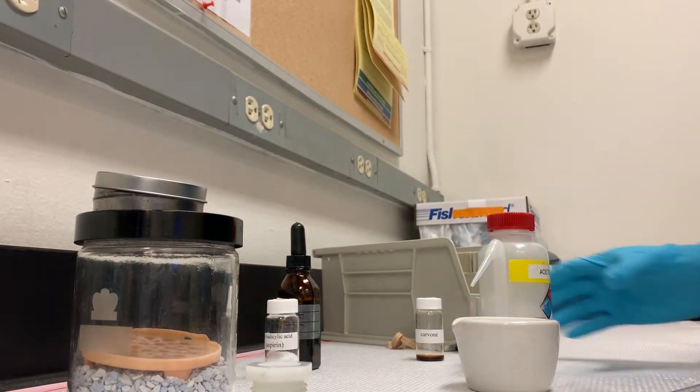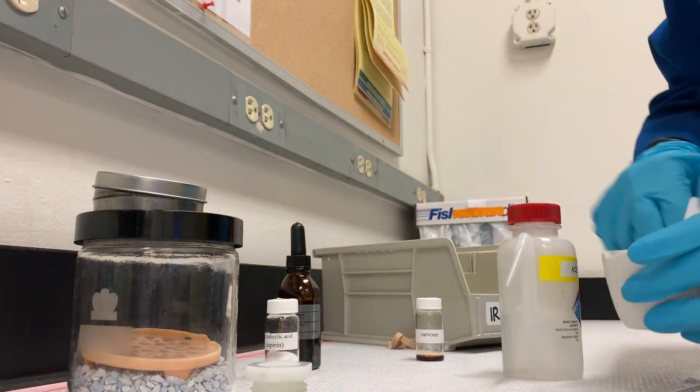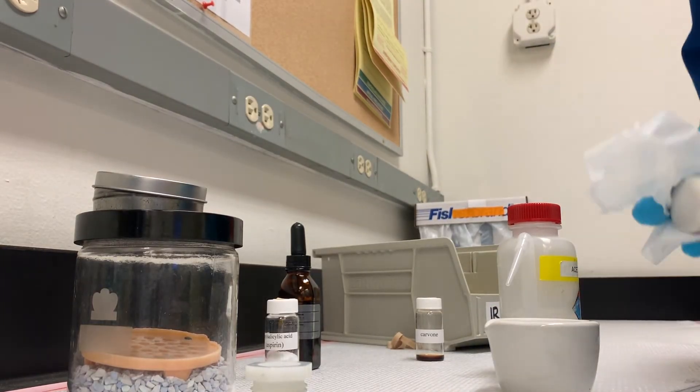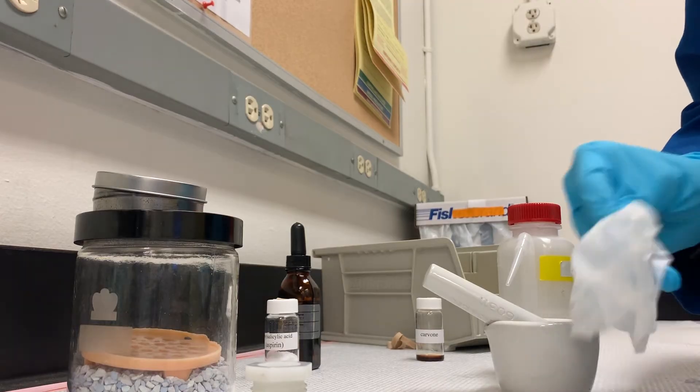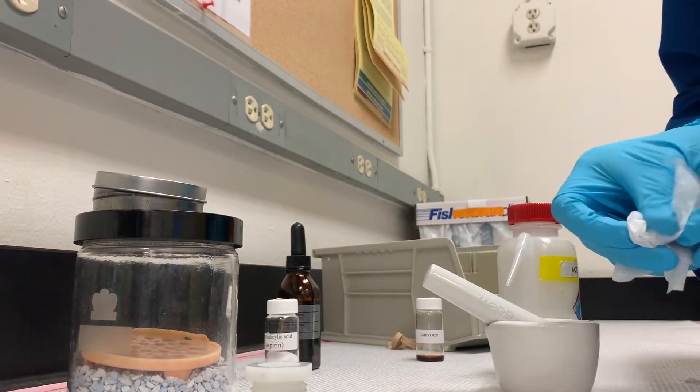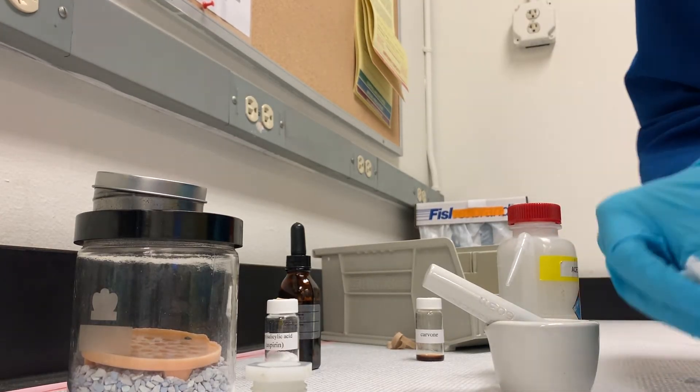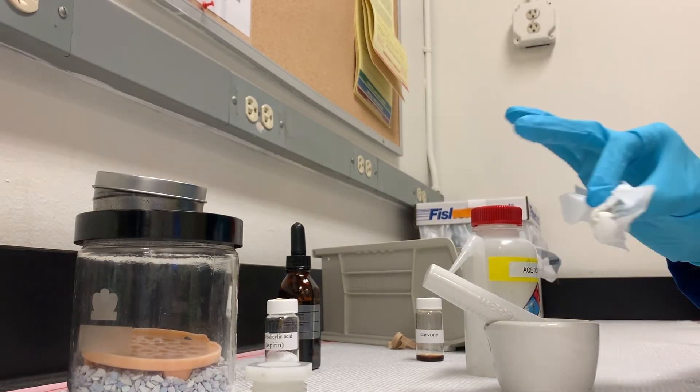Just a quick little demo for cleaning. Spray a little acetone in there. Get a fresh kim wipe. Wipe that guy out. Wipe off the pestle part. Wipe off the rubber policeman and the spatula. Throw away the little pieces of kim wipe. Don't just leave them out on the counter, please. Thanks.